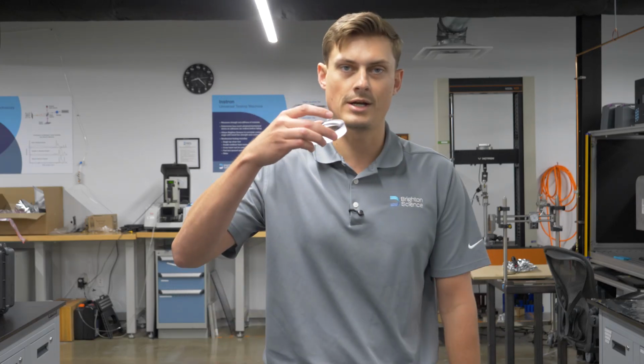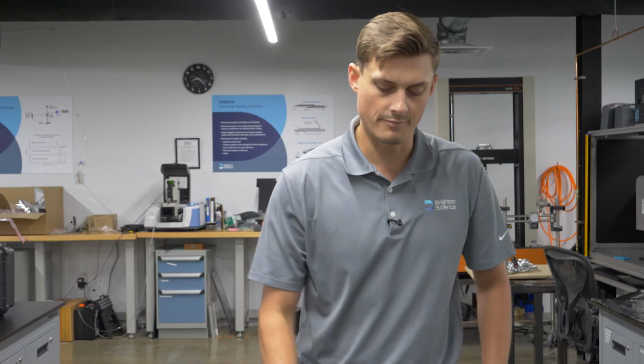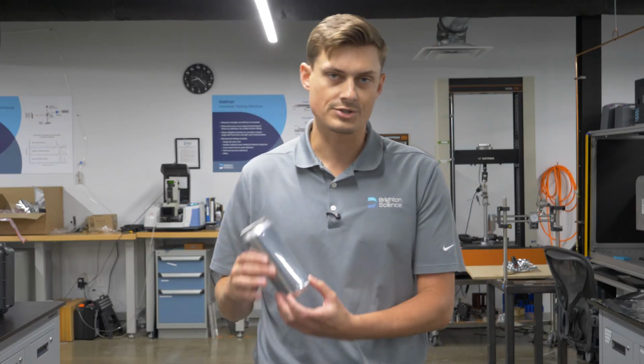You're joining us today in our lab to discuss a question I get often from our customers, and that is, how do our devices handle measuring surfaces with complex geometry? So today, to illustrate its flexibility, I have a glass component here with a concave and convex surface to measure, as well as this can.